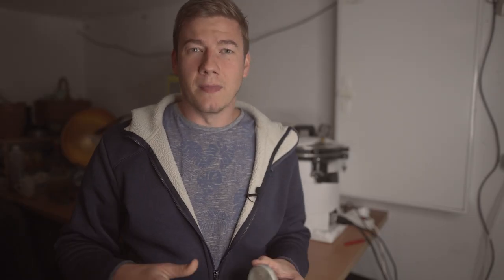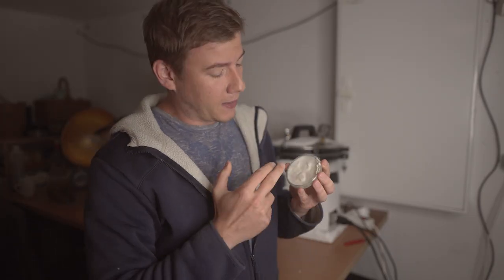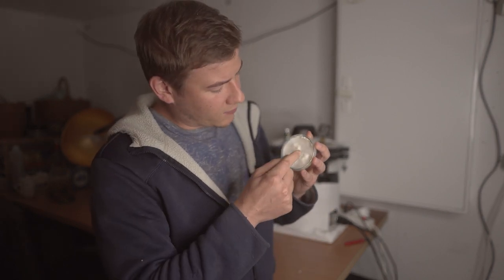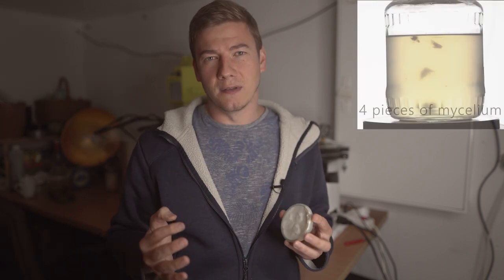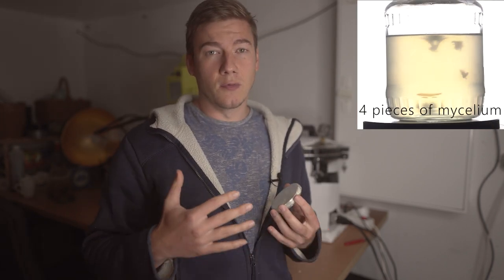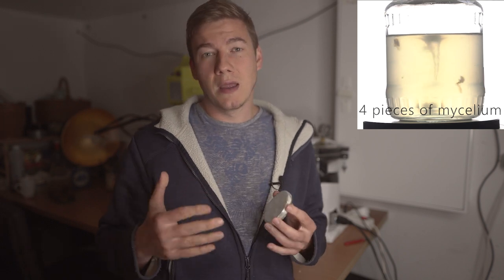Now I want to make some liquid mycelium with king oyster mushroom mycelium, and actually there are three different ways to do so. The first is just to cut the agar with the mycelium into slices and put the slices into the honey mixture. I like to scratch or scrape the mycelium off the agar and just put the mycelium into the solution. And the third one is just to buy a liquid culture syringe, which is about 10 euros, and use the liquid culture to multiply it.